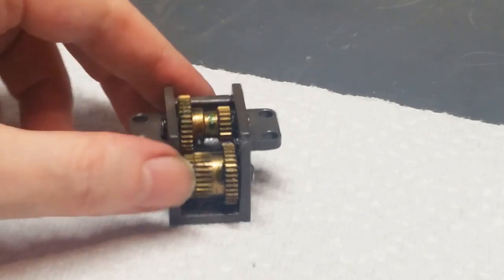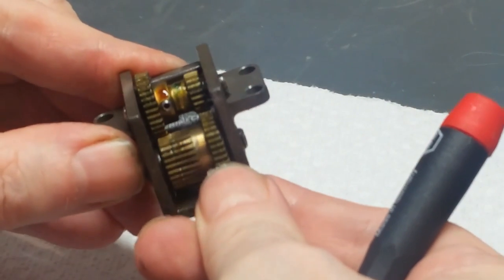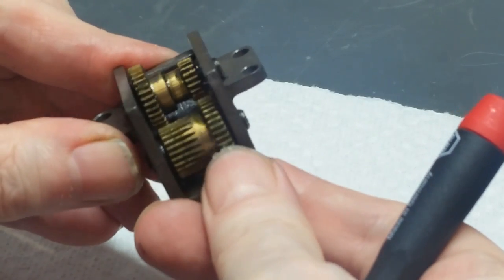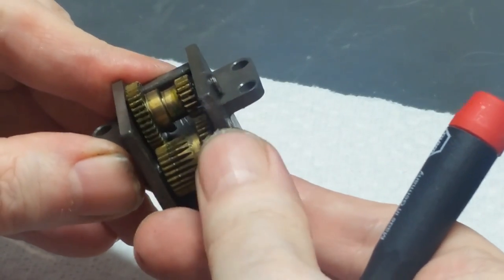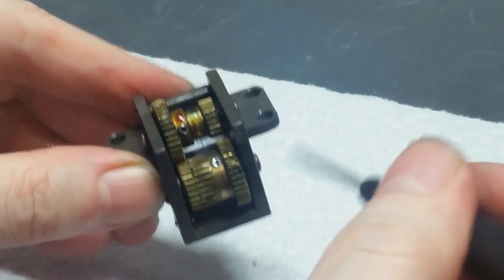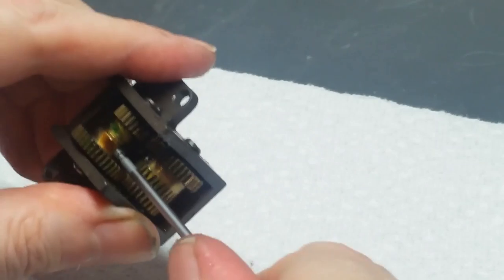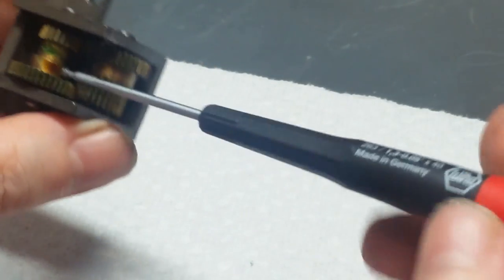Okay, so it's gearbox time. This thing is really stiff. This thing ought to move very freely, and it's really stiff, and as you can see, the gears are gummed up, and it's a mess, and this is very typical of scopes, and this is why they behave very badly. Like if you just buy one from eBay and try to use it, good chance you won't be happy.